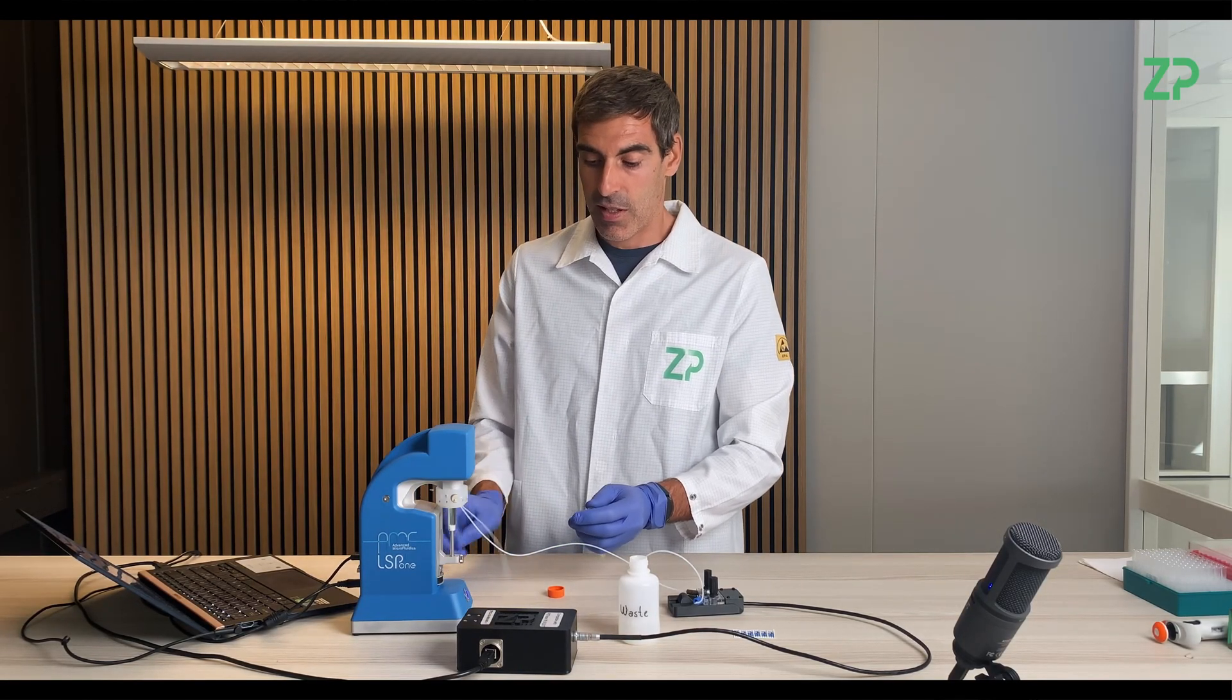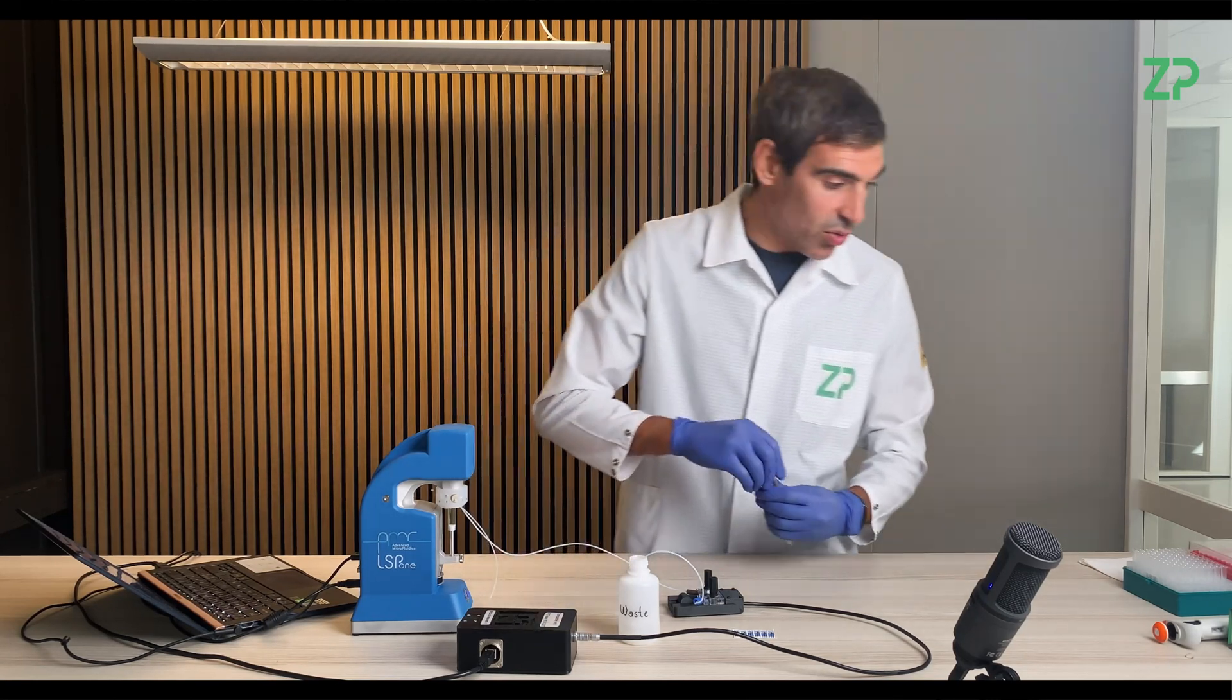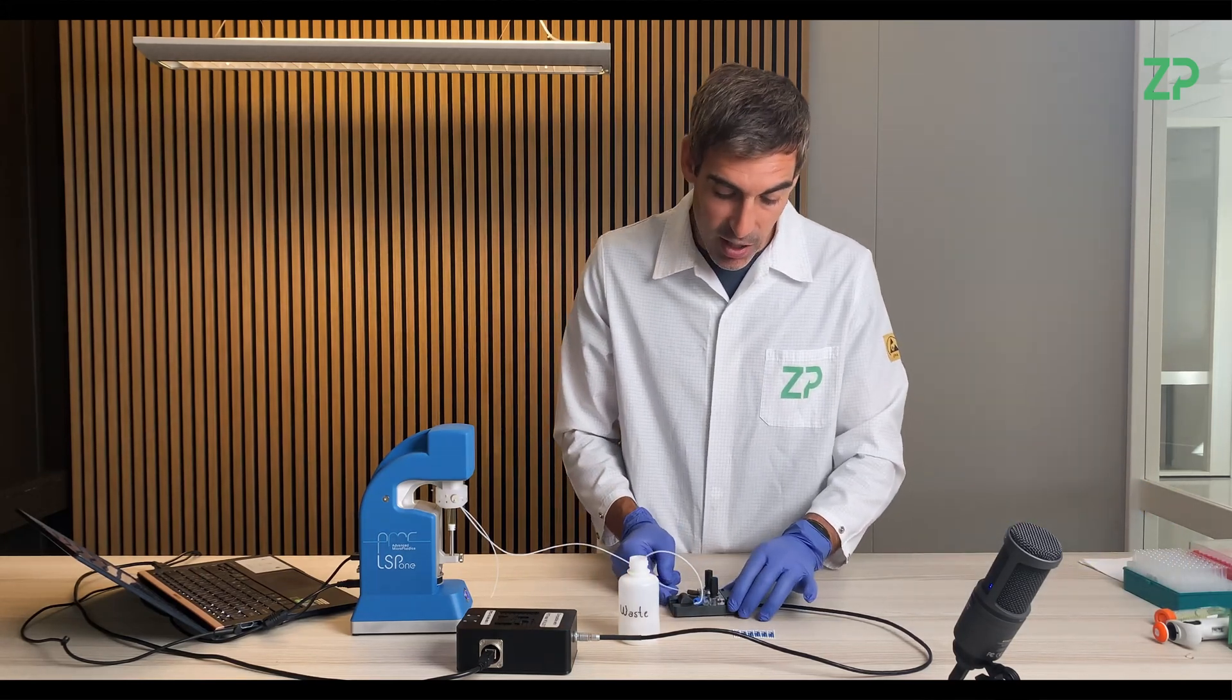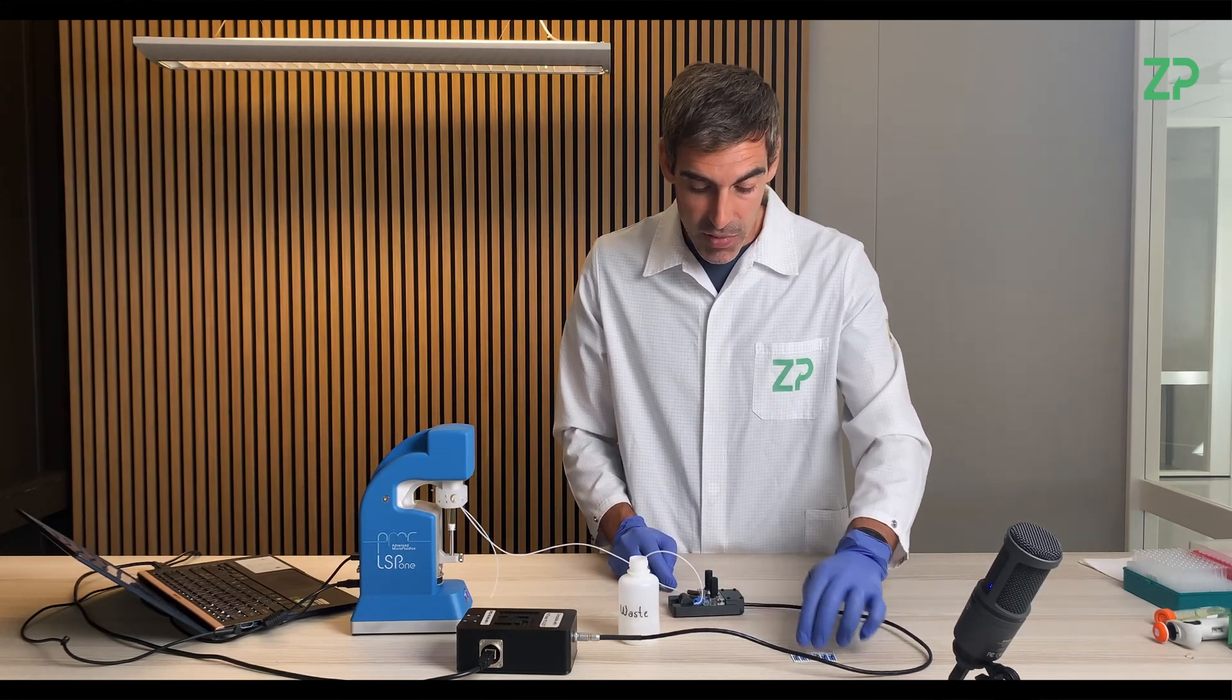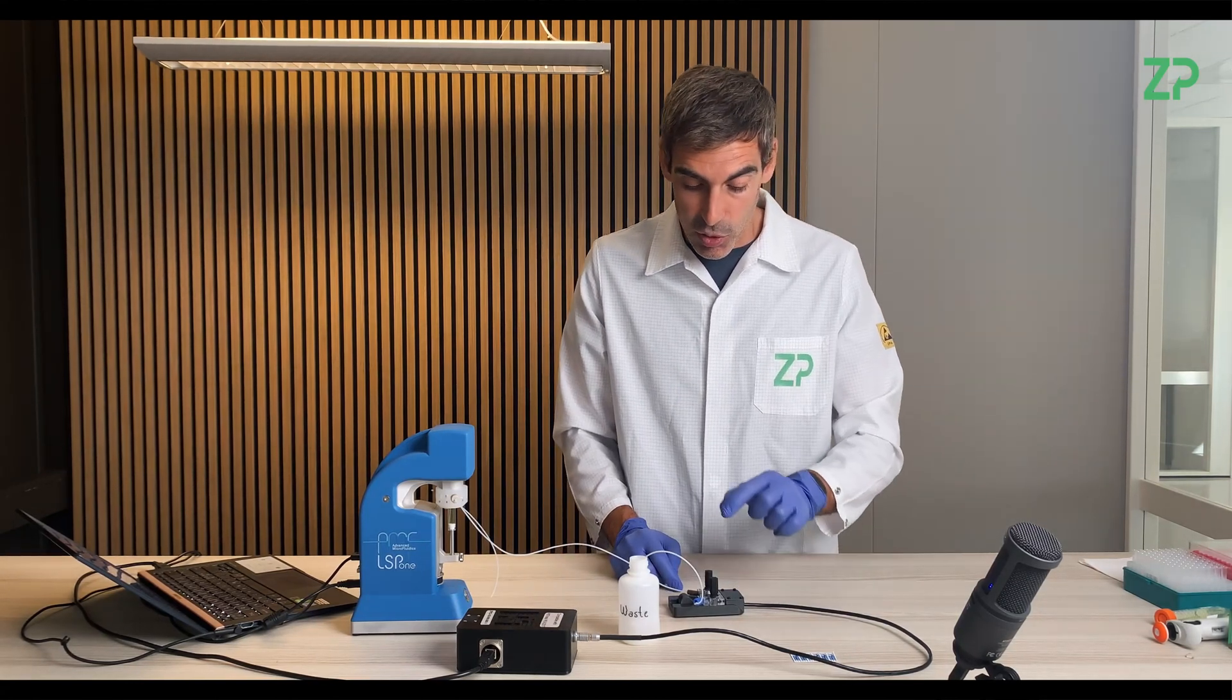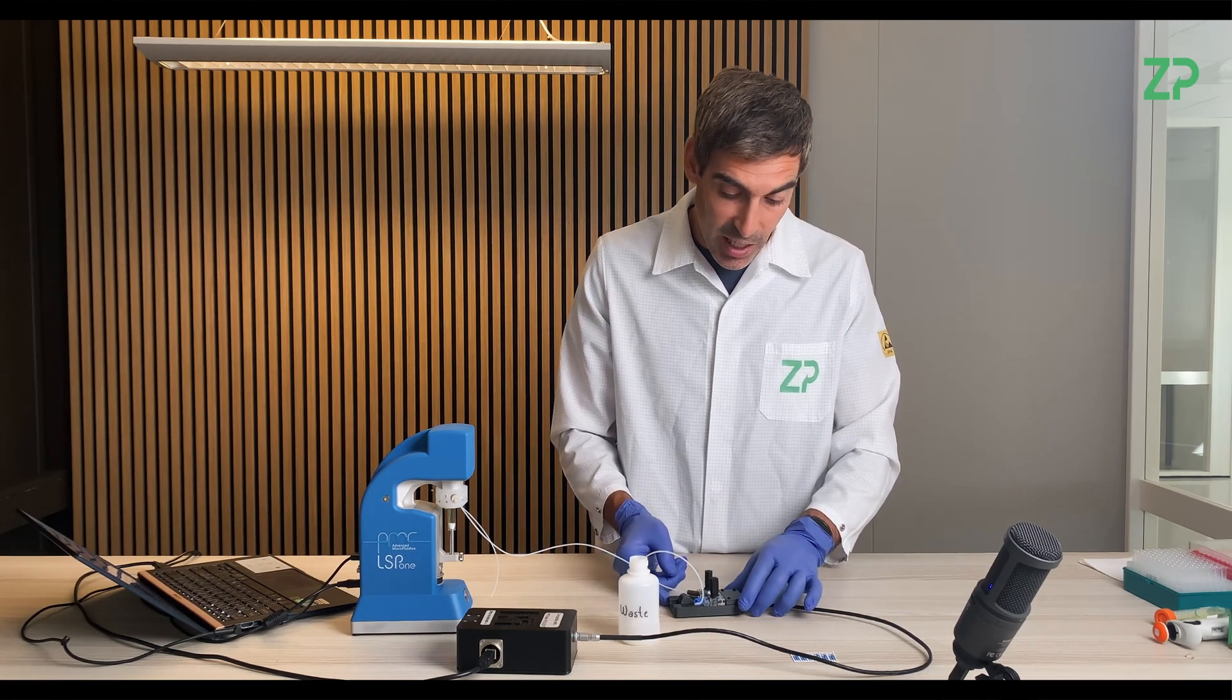So now, as this happens, soon the solution, the liquid, the ferricyanide, should start arriving to the flow cell, to the reservoir, fill the reservoir which is over the electrodes.